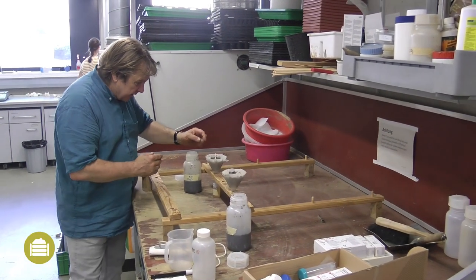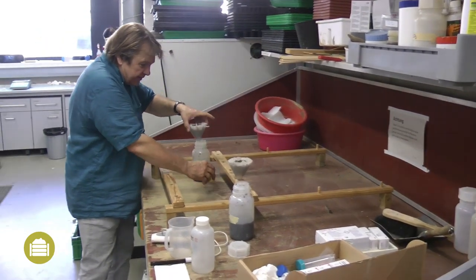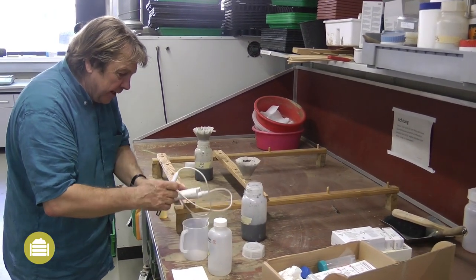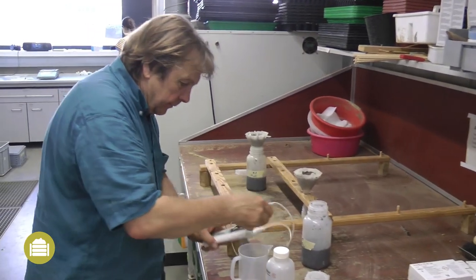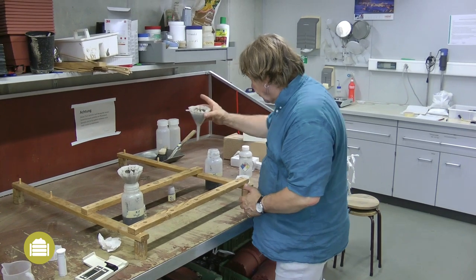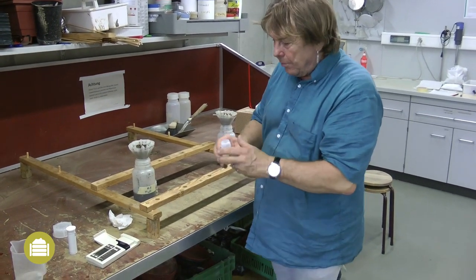Now I have enough water extract and can therefore measure the electrical conductivity of the extract. This gives us information on the salinity of the compost. I have now also enough calcium chloride extract and proceed to the measurement of the nitrite, nitrate and ammonium.